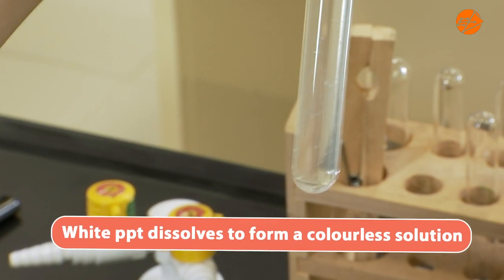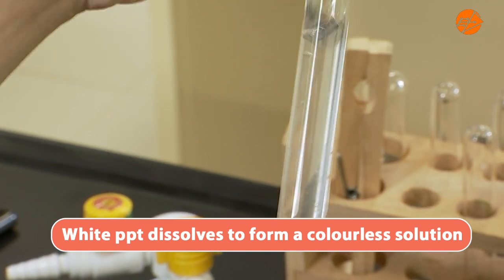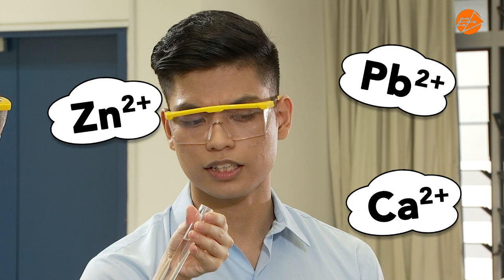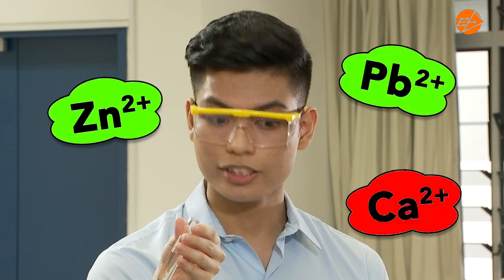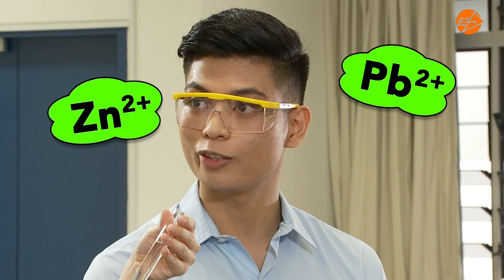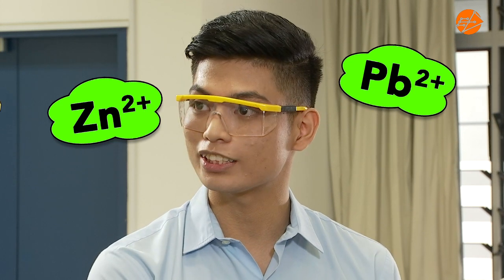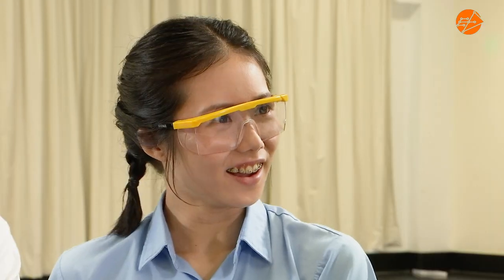I see white precipitate dissolving as more sodium hydroxide is added. I get a colourless solution now. This tells us it's either zinc or lead(II) cations. Since we already know that the unknown can only be calcium chloride or zinc nitrate, we can confirm that the cation present in this solution is Zn²⁺.